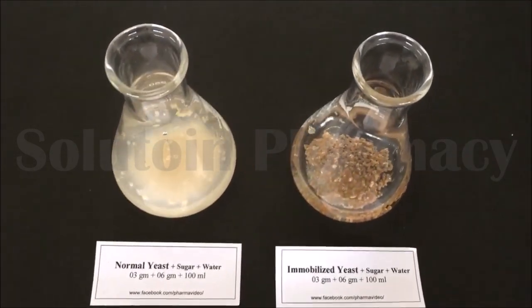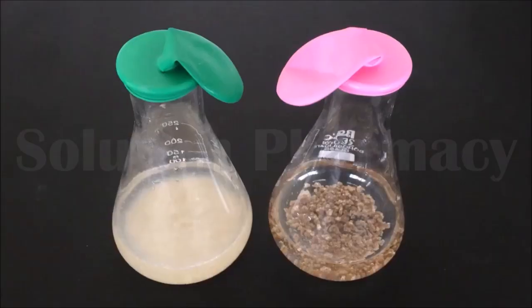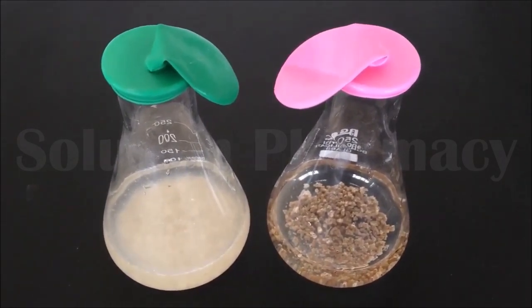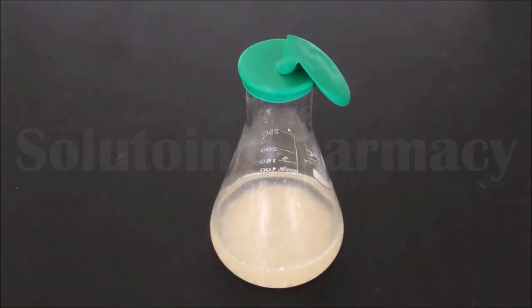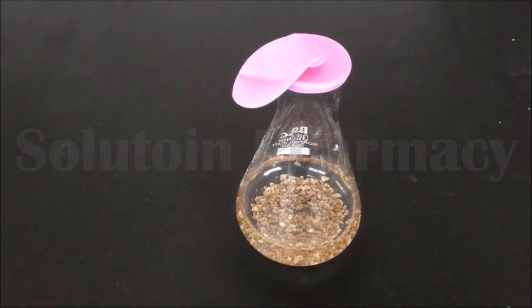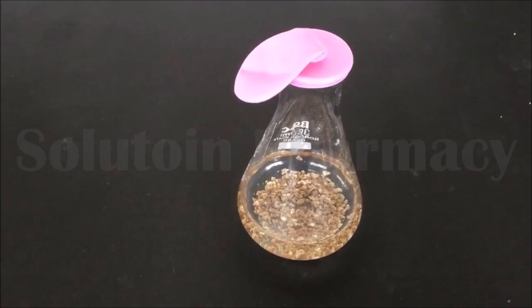Now cap and cover the opening of each conical flask with two different color balloons — green and pink. The conical flask with the green color balloon contains unimmobilized yeast cells that get mixed with the liquid, while the conical flask with the pink balloon contains immobilized yeast cells that remain intact inside the sodium alginate bead.